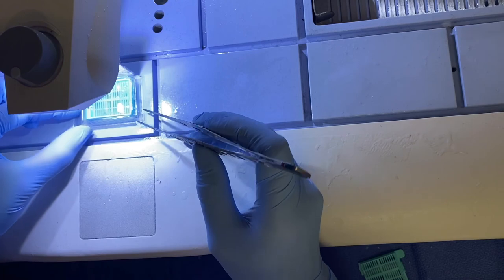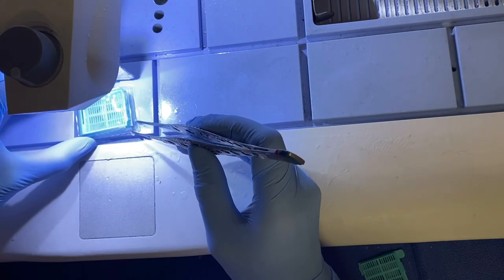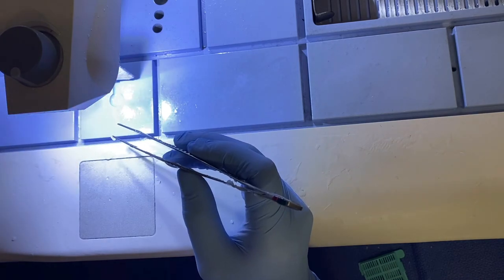Then we're going to top it off, and then we're going to move it over here to our large cold plate.